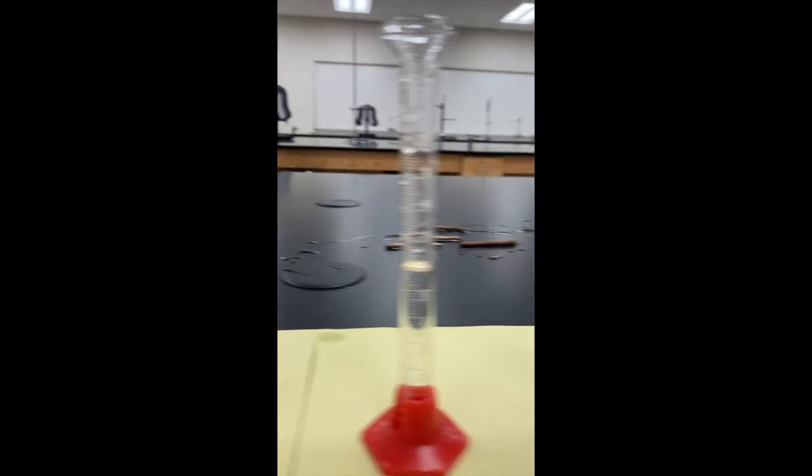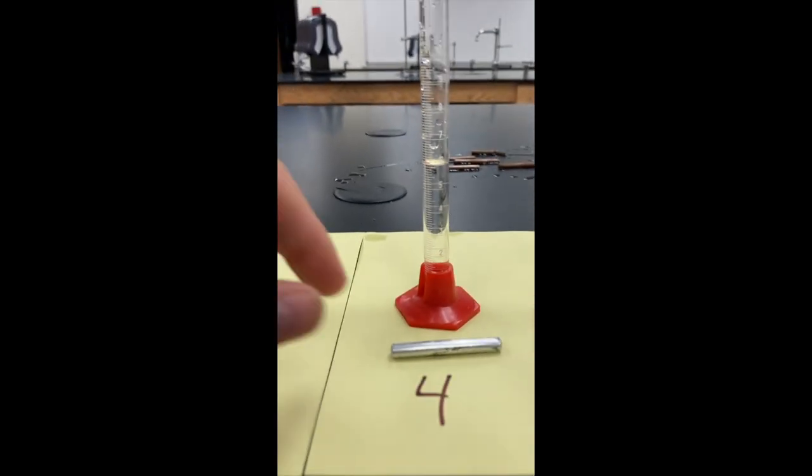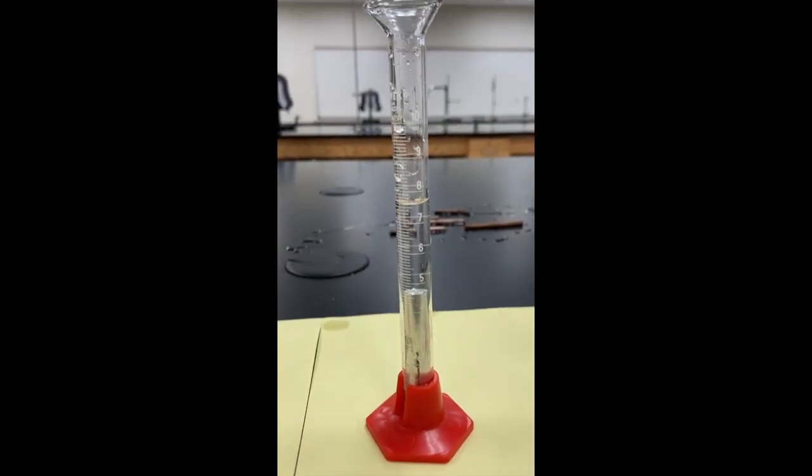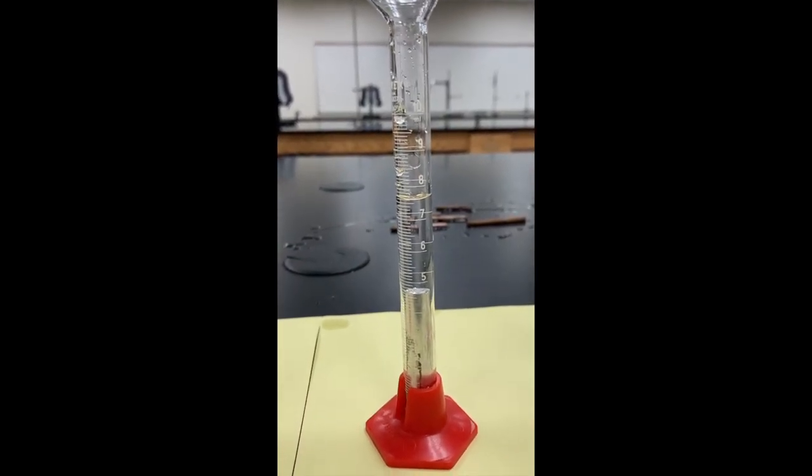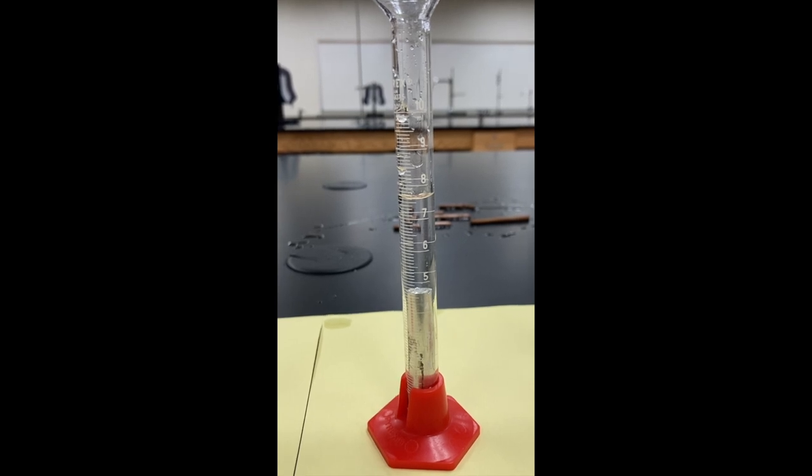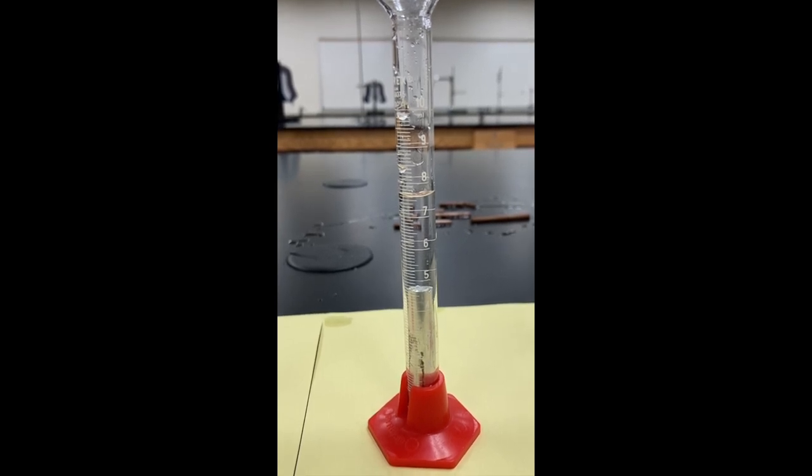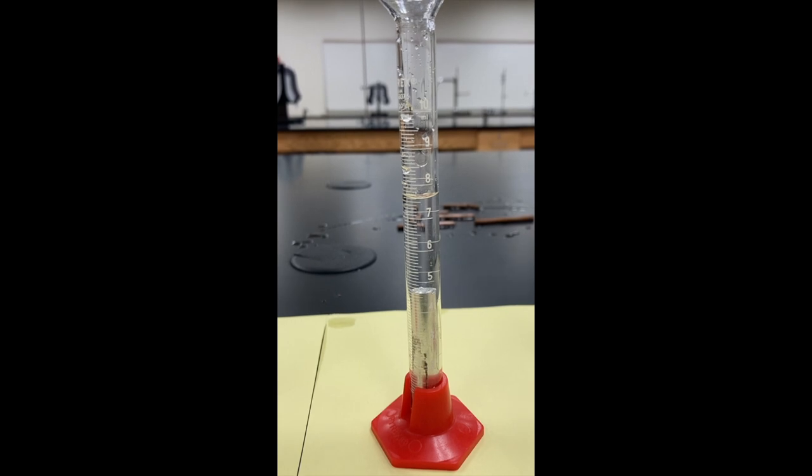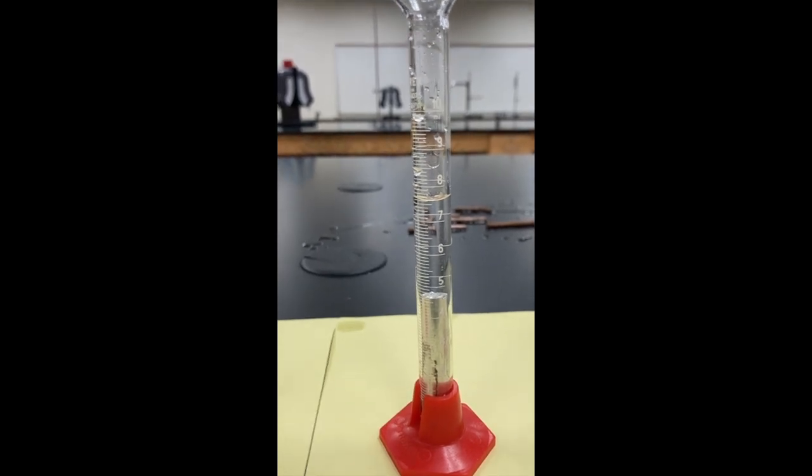All right, here we go, piece number four. Pop that in there, and you're reading the volume from the bottom of the meniscus on the graduated cylinder there. If you need time, feel free to pause the video.